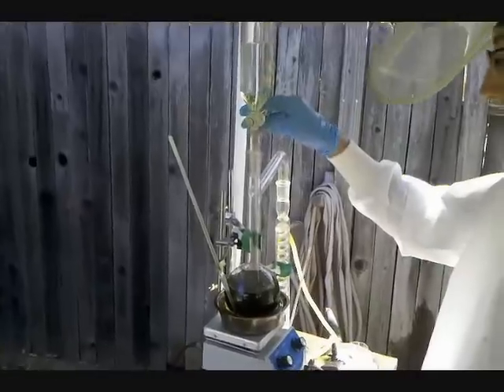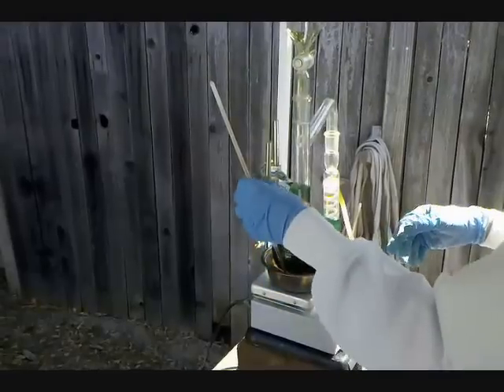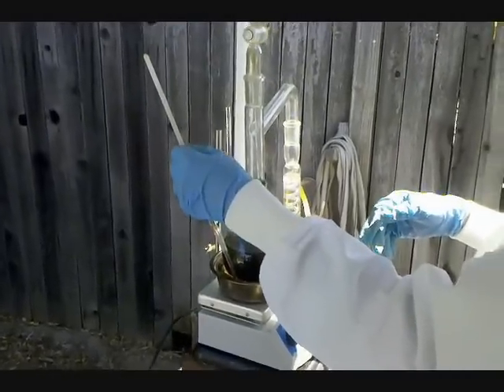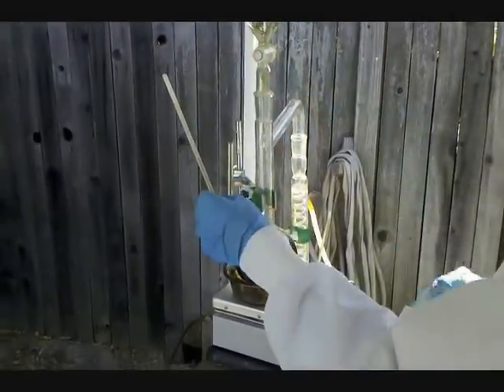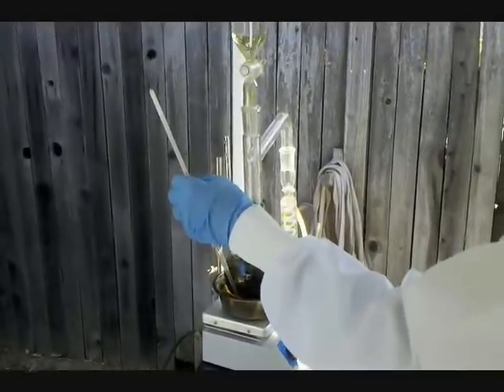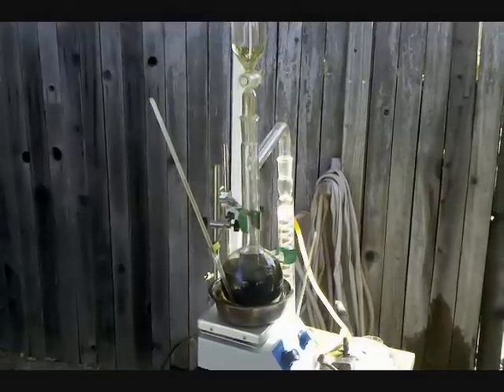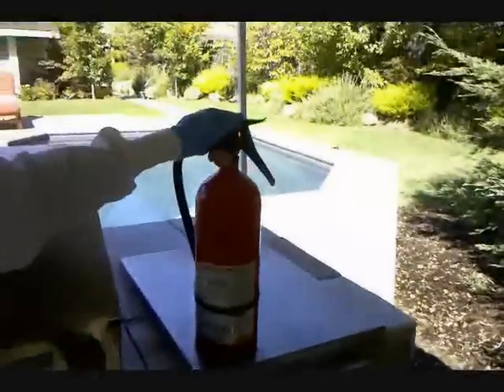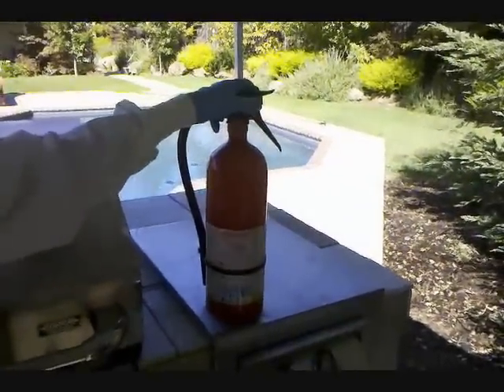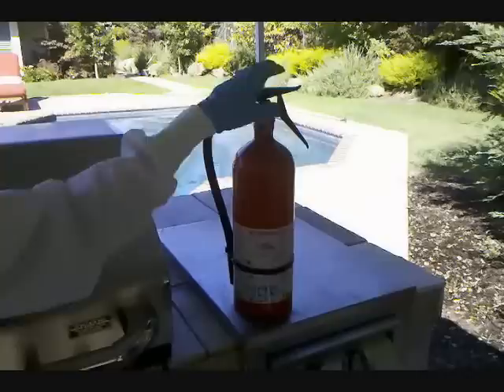I'm adding it every now and then when the reaction slows down. The oil bath is 145 degrees Celsius right now, which is the range you want to keep between 135 and 145. Do not go above 170 degrees Celsius because ether auto-ignites at that point. It's a good idea to have a fire extinguisher close by because ether is really flammable, and if this reaction catches on fire, you're going to want to put it out fast.